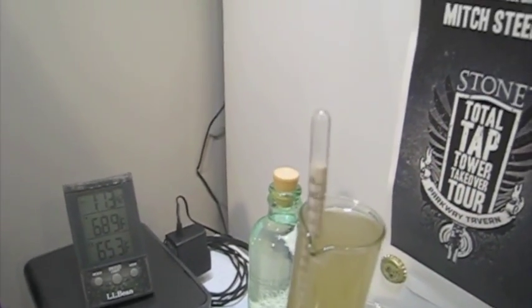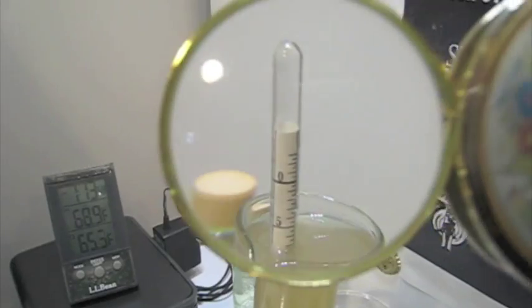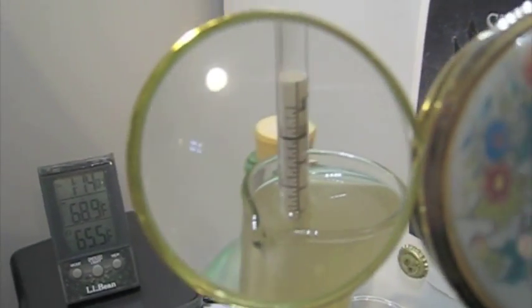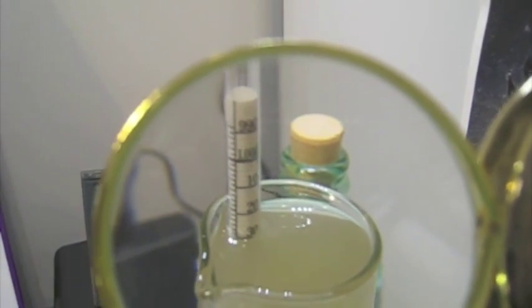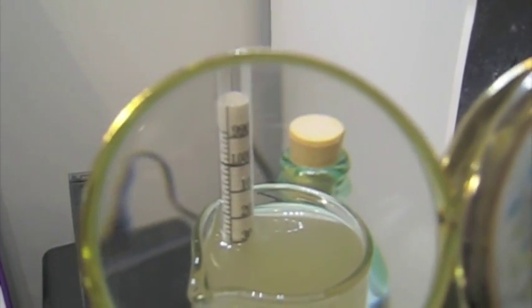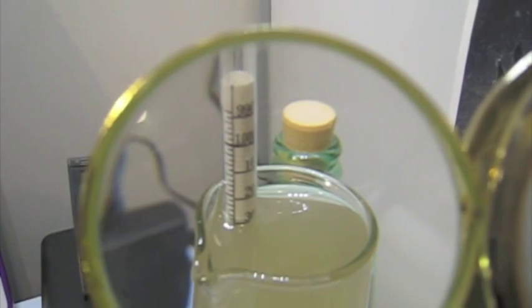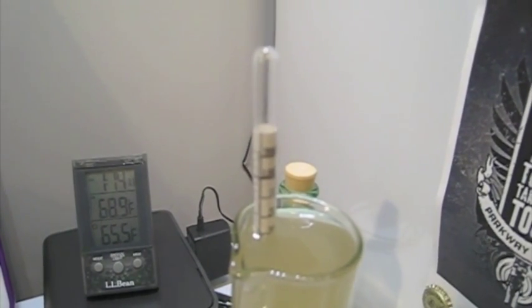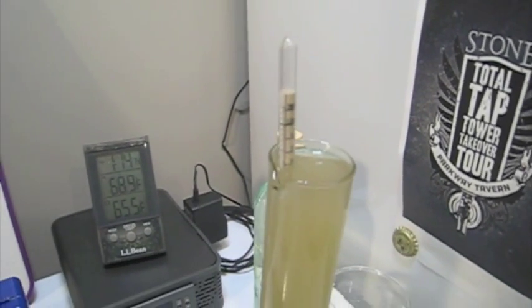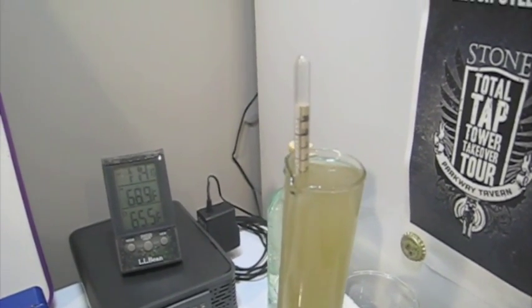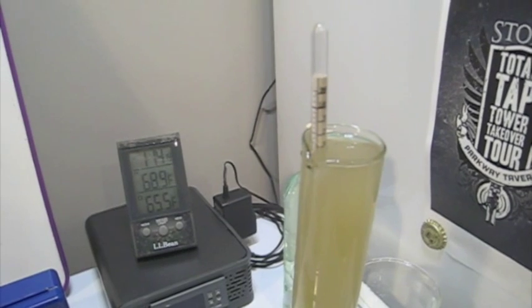Give it a little spin here. Look at this. We can see the value on it. And you can see we're right at 1030. So we'll use that as our calibration to monitor our refractometer results.